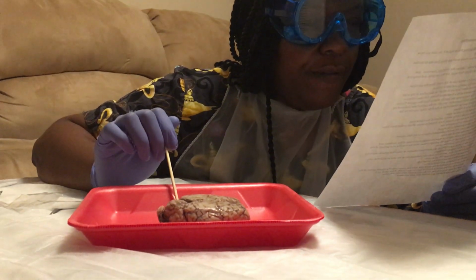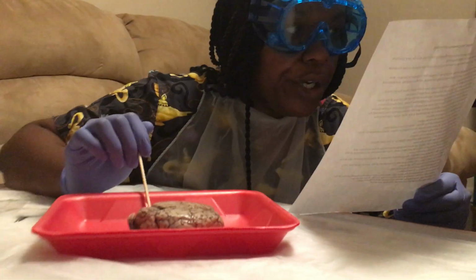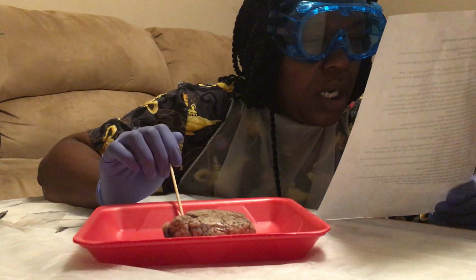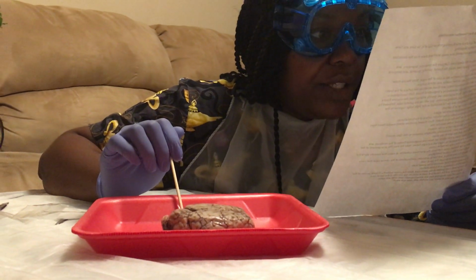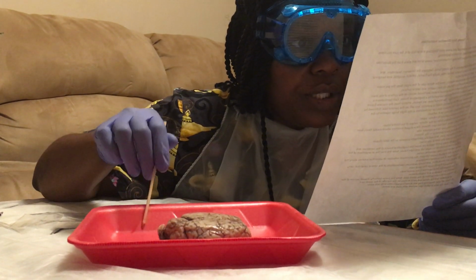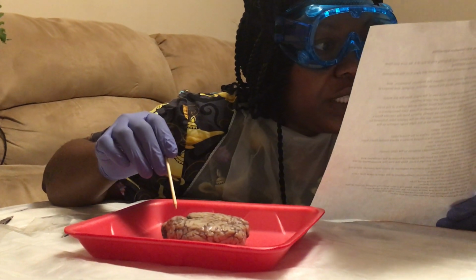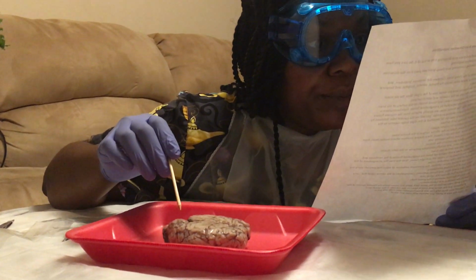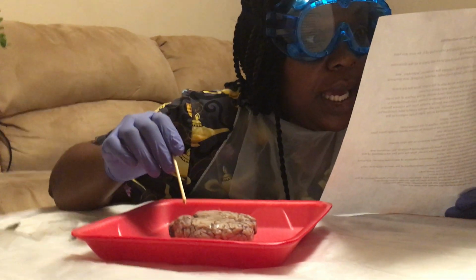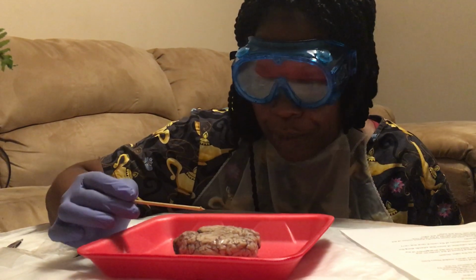Place the brain ventral side down to view the dorsal side of the organ. Note the pia mater extending downward into the sulci on the superior and lateral surfaces. Observe the dura mater, the arachnoid mater, and blood vessels on the surface of the brain.